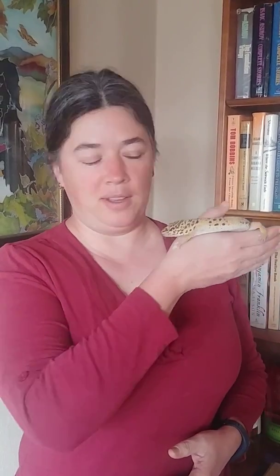Hi everybody, this is Dr. Claire and this is my friend Wallace the gecko. Today we are going to be demonstrating how you would have collected data for this experiment if we weren't in the coronavirus. So let's get started.